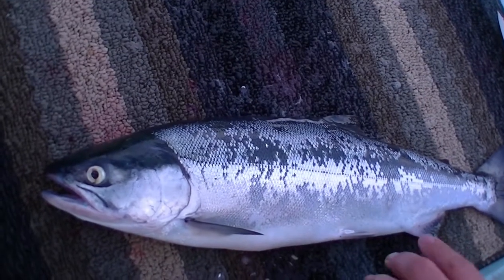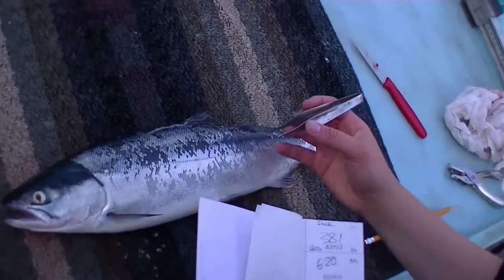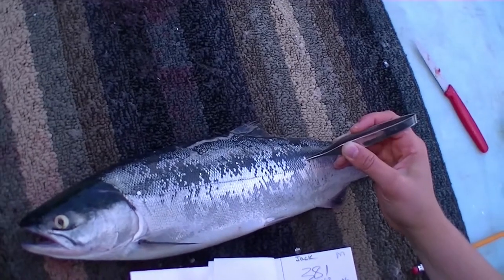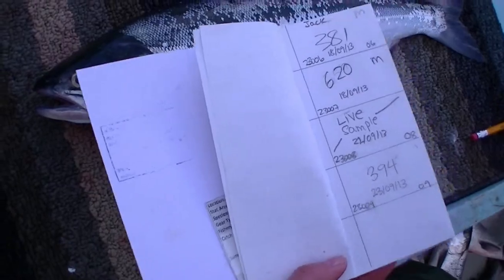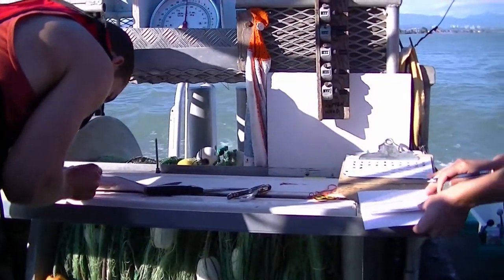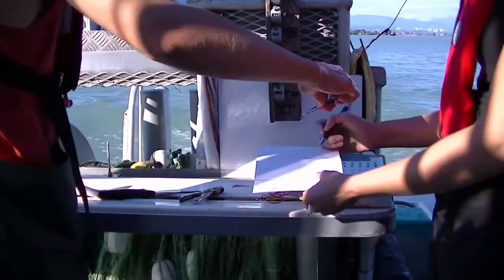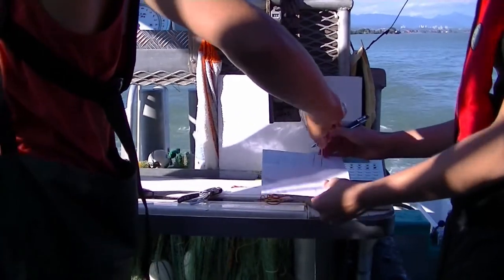If the preferred scale on the left side is unavailable, the scale should be taken from the same scale row as close as possible to the left or right. If no nearby scales are available on the left side, the scale sample can also be taken from the right side of the fish. If there are no suitable scales available, make a note in the scalebook and continue collecting the other sample information.